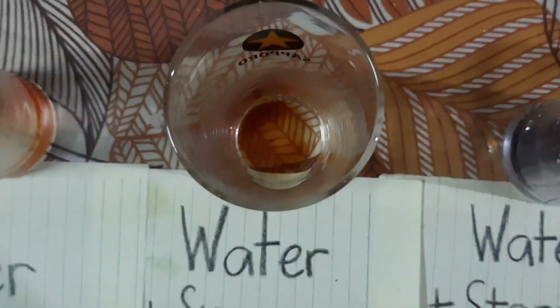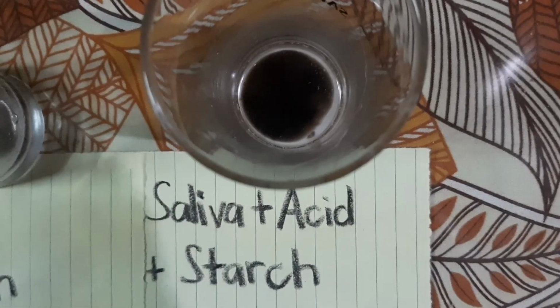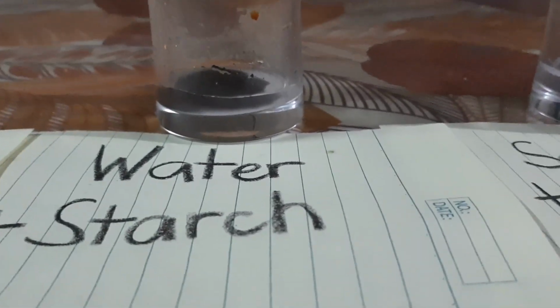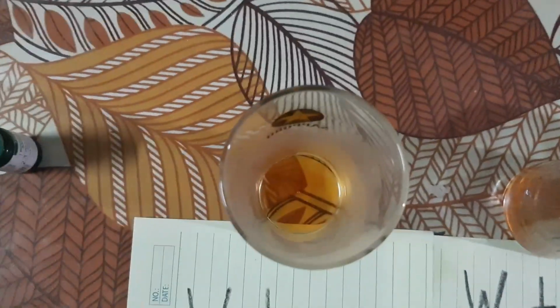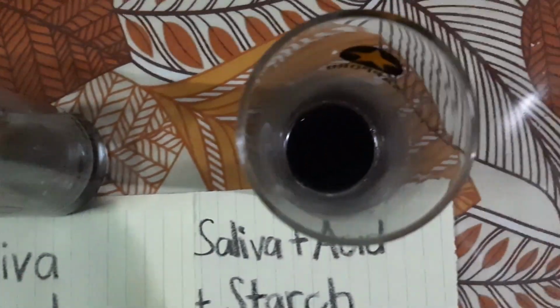The samples change in color because the iodine reacts to a specific substance called starch. The iodine solution determines the presence of the starch in each cup. The first 2 cups became orange-brown in color. This happens because the iodine solution is normally orange-brown in color, and there is an absence of starch in the cups. The 3 other cups turned purple-black. The iodine solution detects the presence of starch in these cups, and that is the reason why the color changes.